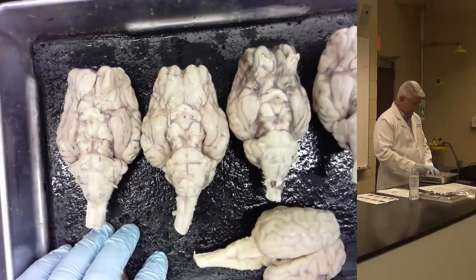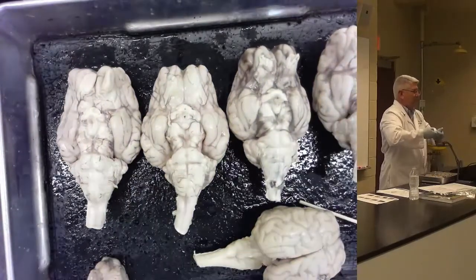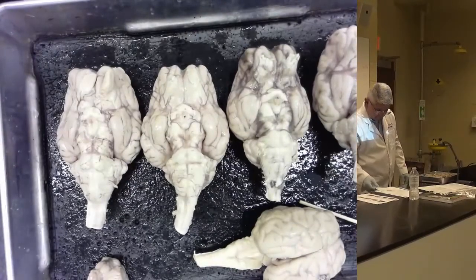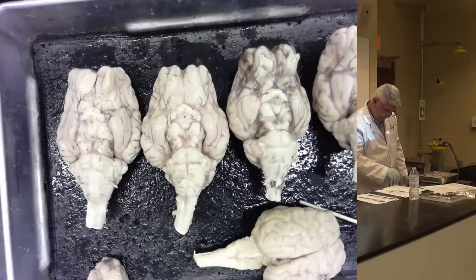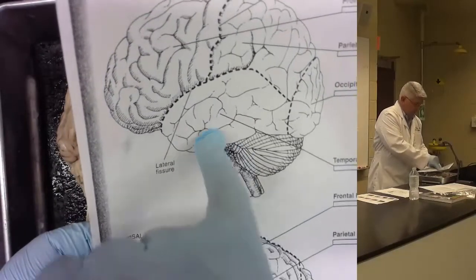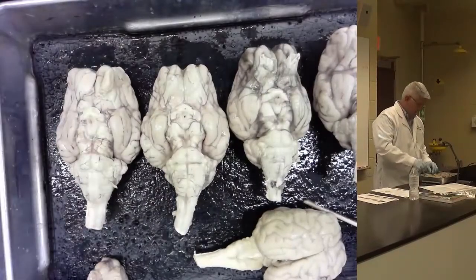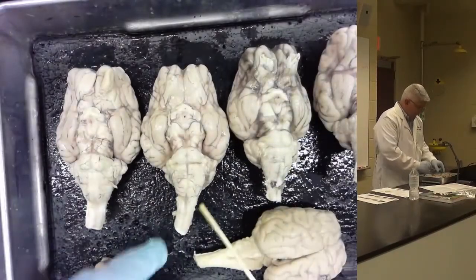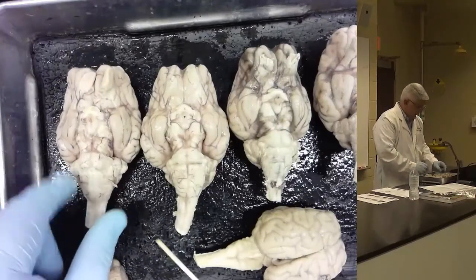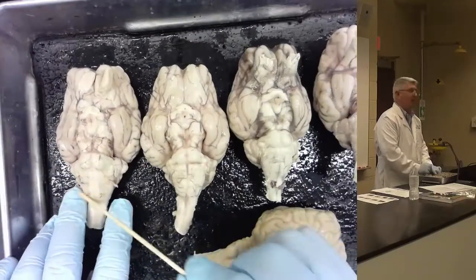In the V part. So this is a slightly different pons, but the pons always sticks out and protrudes some. In fact, you can see here on this one, that bump that's sticking out, that's the pons. All right, so that's pons. This whole area here, that's a trapezoid, this is spinal cord. In between the pons and the spinal cord, and I'm not marking spinal cord, is the area called the medulla.